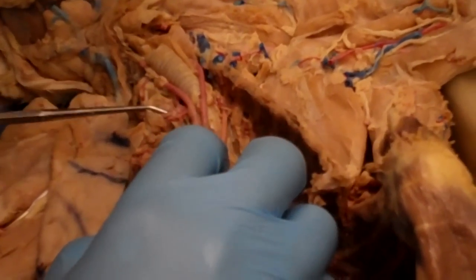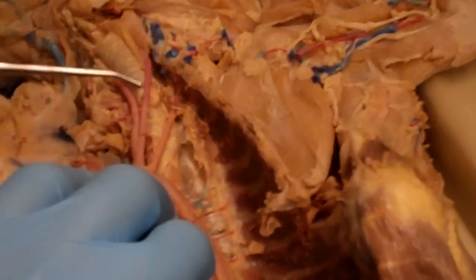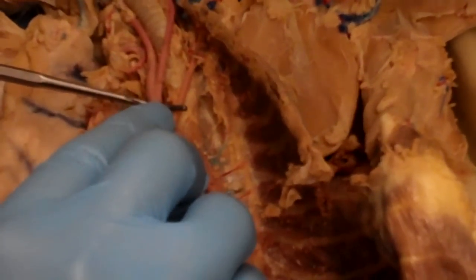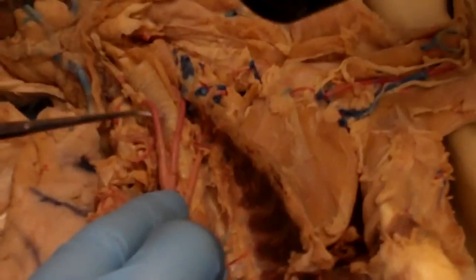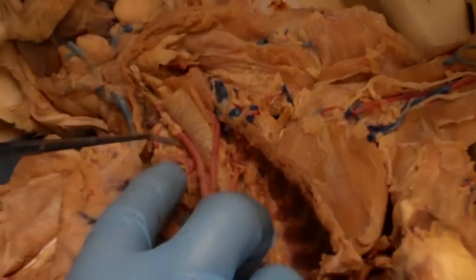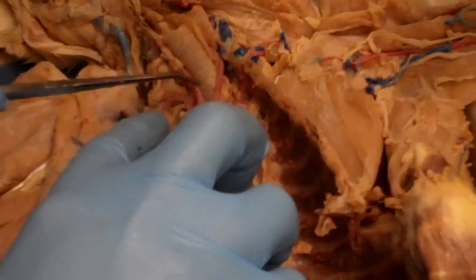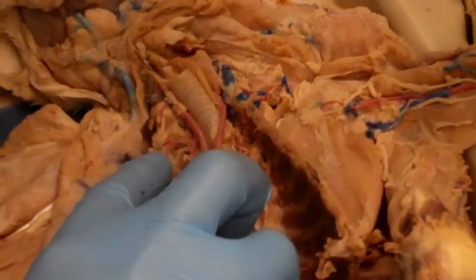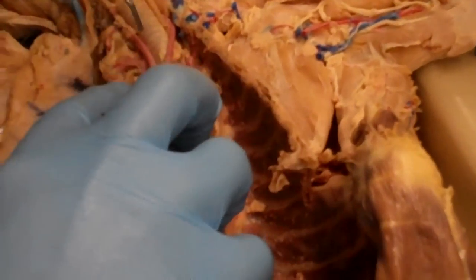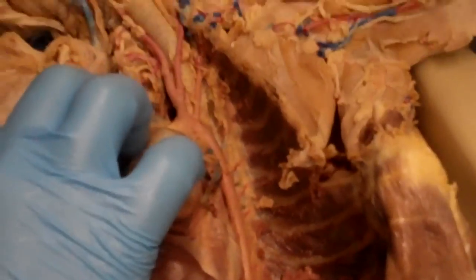Okay. So we talked about the left subclavian artery over here. We have the left and right common carotid arteries coming off this brachiocephalic trunk. And then as soon as the right common carotid artery comes off of the brachiocephalic trunk, the vessel will just continue on as the right subclavian. So the carotid arteries are going to go up and do the head and the brain. The left subclavian will do the left forelimb, and then this right subclavian will go out and do the right forelimb.